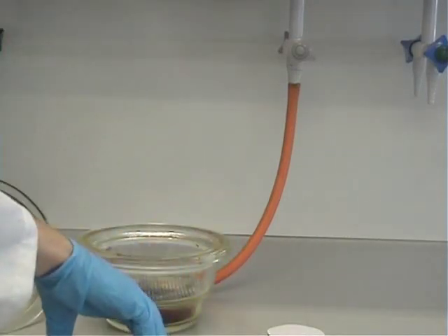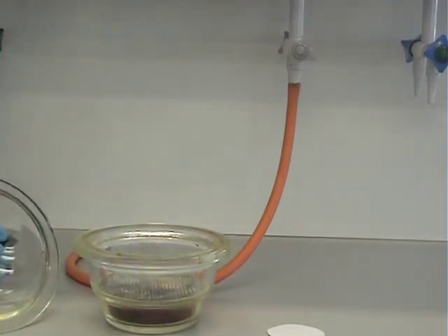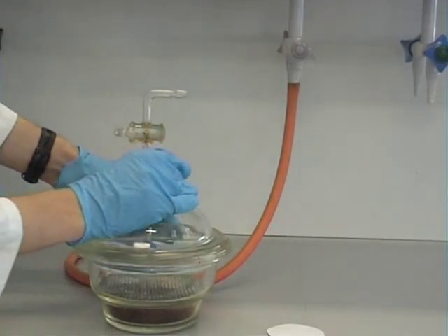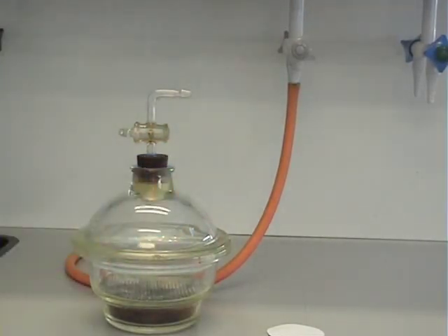It is important when storing the desiccator that the lid is closed and that the tap on the top of the desiccator is closed as well.